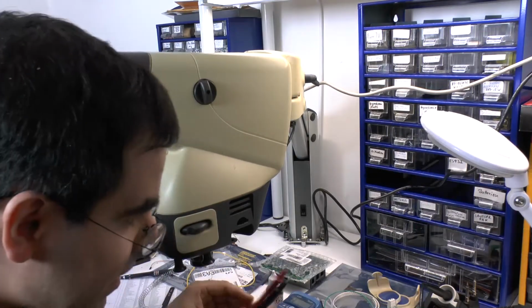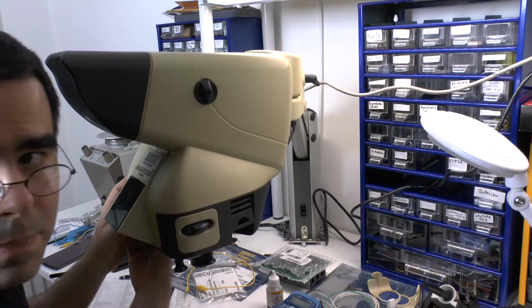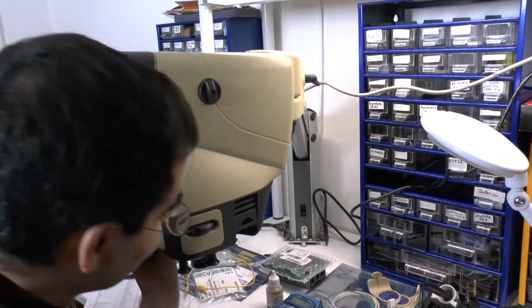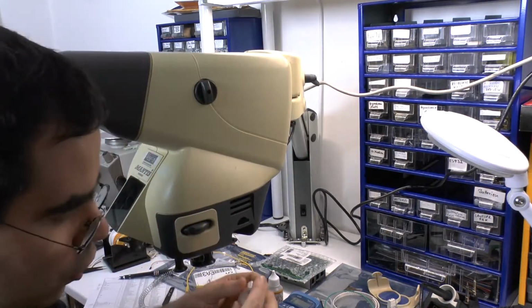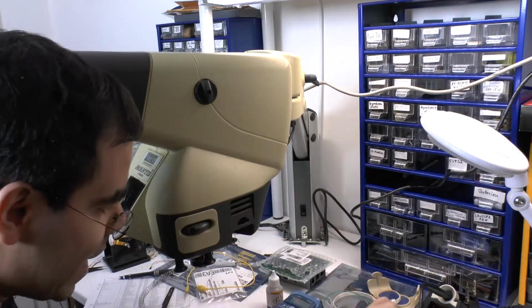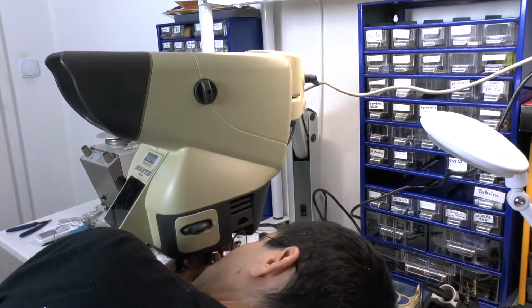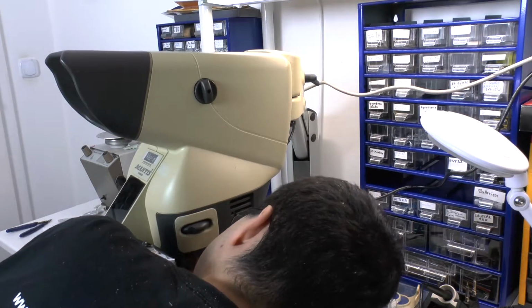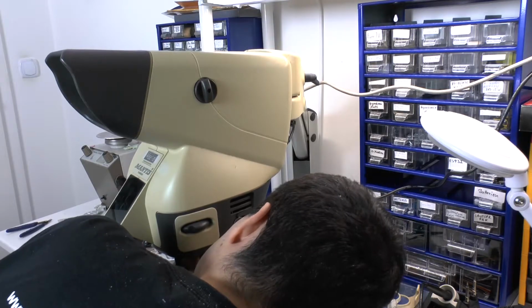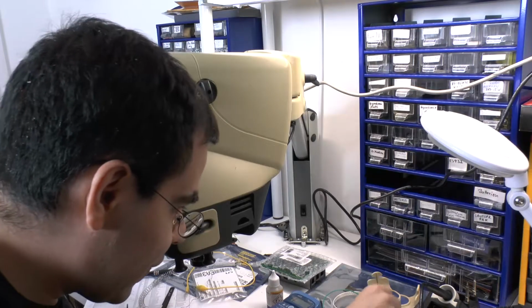Ouch! But the reason for that is that these old lamps have a very high impedance, a very low impedance, sorry. And so you need to take both of them out and then the short will disappear on the inside, as I'm showing you now. And the short is gone. So, what do we have here?